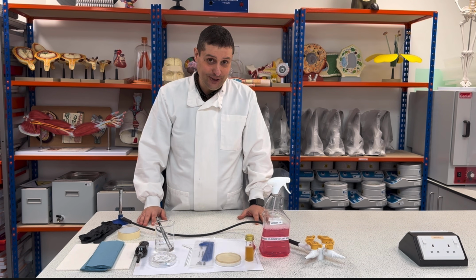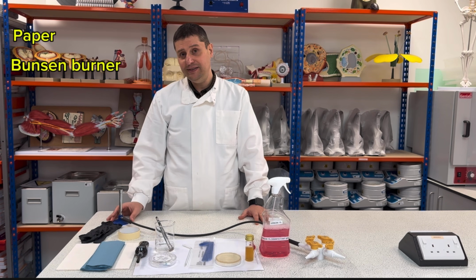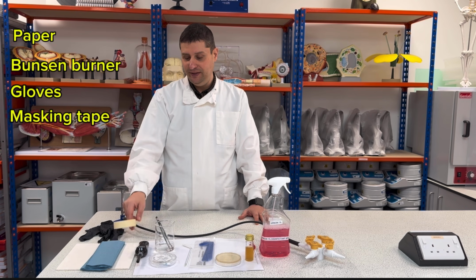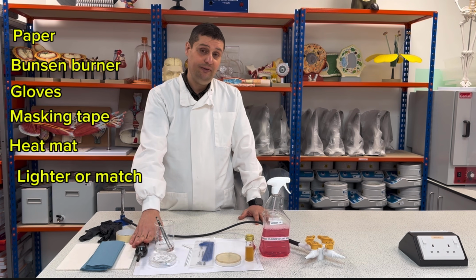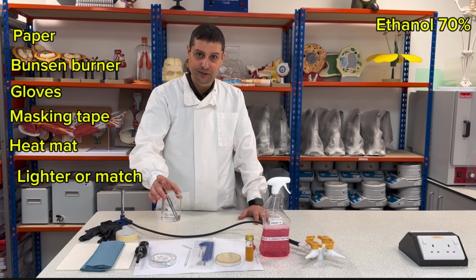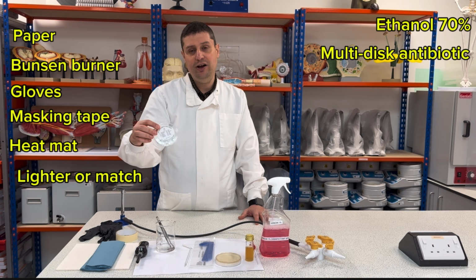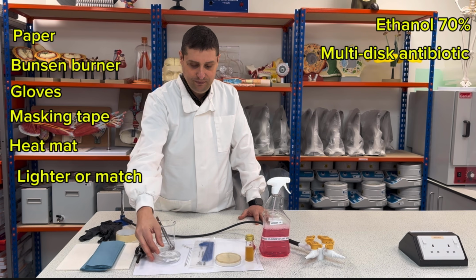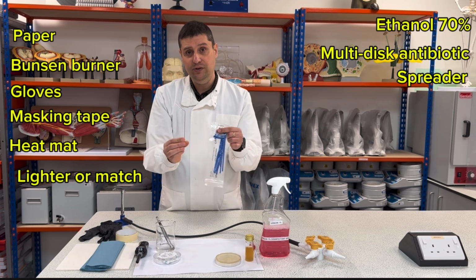So for this practical, we will use paper, Bunsen burner, gloves, masking tape, heat-proof mat, a lighter, or it can be a box of matches. I need ethanol 70%. I need an antibiotic multi-disc ring, so I will talk about this later. I need my spreader. We can use two kinds of spreader.